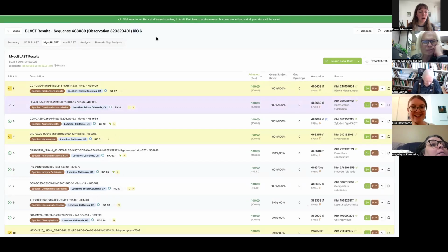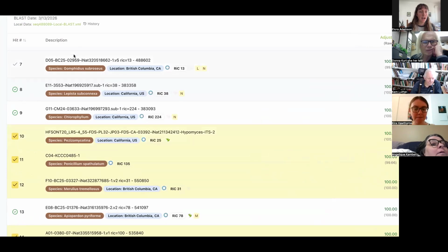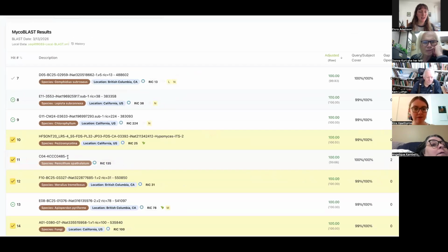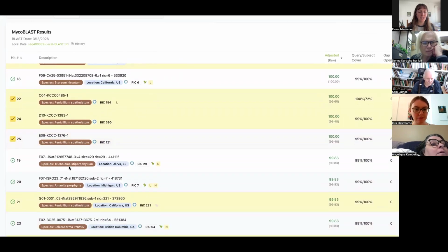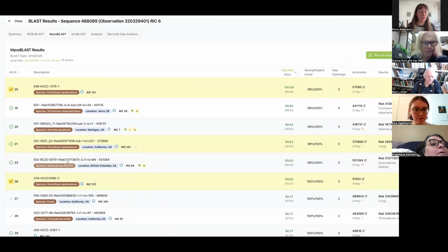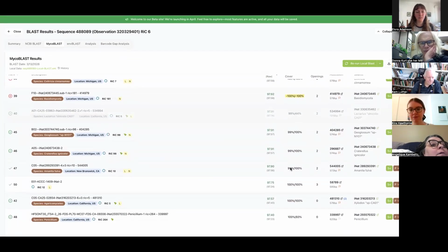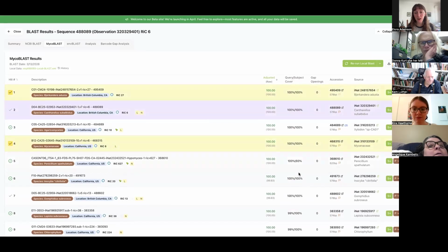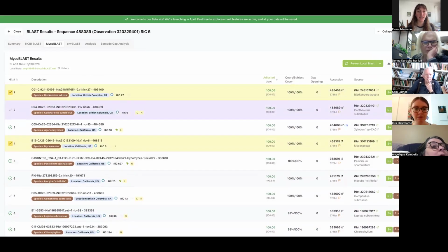6 reads, not super promising and looks bad. Again, we're seeing IDs of fungi just all over the map. There's no consistency in the genus and family. We know we're looking for a chanterelle. There's not even a ton of good matches, but even if there are at the top, it doesn't matter because the only chanterelle we see in this list is ours, which is purple. This is also obviously a contaminant.